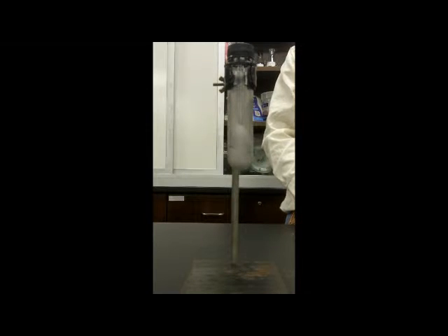People get harmed from these blowing things up. This happens to be the same container before it gets blown into a 2-liter bottle. Very thick walled, very tough, and so that's why it's not blowing up. But needless to say, you have to be careful with this. I've got my safety goggles on, and there it goes.